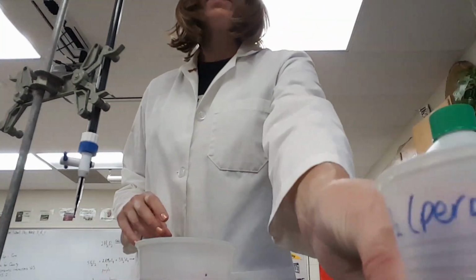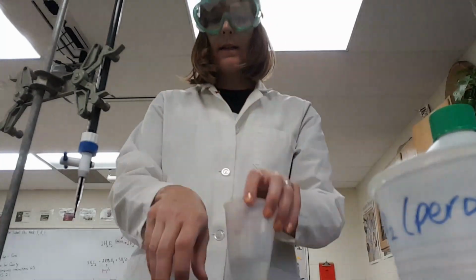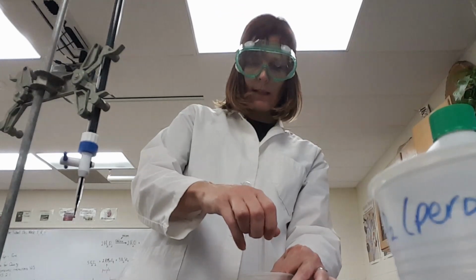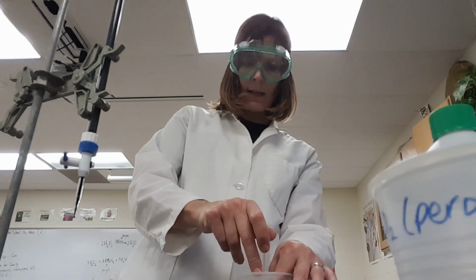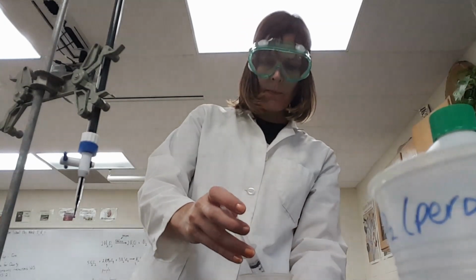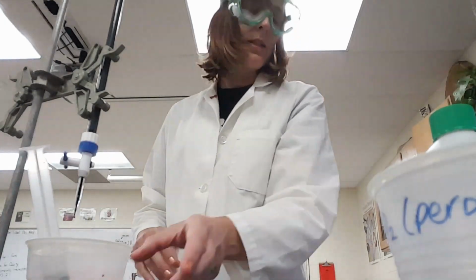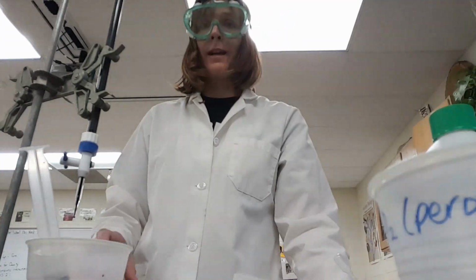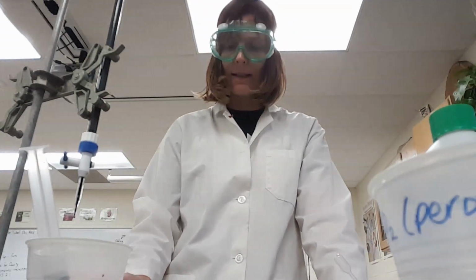All right, now I'm going to get my sulfuric acid ready to go because I am here by myself, so I'm going to be the one that needs to make sure that I hit this right at the end time because my catalase is going to break down a lot of this. I just mixed up some catalase real quickly. It's probably pretty concentrated, so we're probably going to break down a lot of the hydrogen peroxide that's in here.